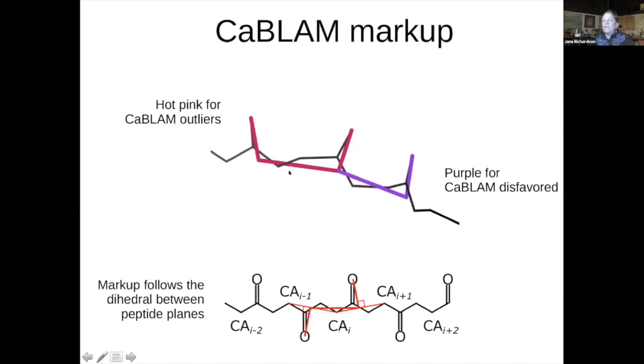And the markup on a structure uses those carbonyl directions. And so for a 1% outlier, it does it in magenta, a hot pink, and for a 5% outlier, which is maybe suspicious, but not reliably bad. That means that 5% of the good data has purple outliers. But for instance, if you have a purple one next to a 1% outlier, then it probably means that the central carbonyl or the central peptide in here is what's wrong and what you need to rotate in order to fix the outlier.